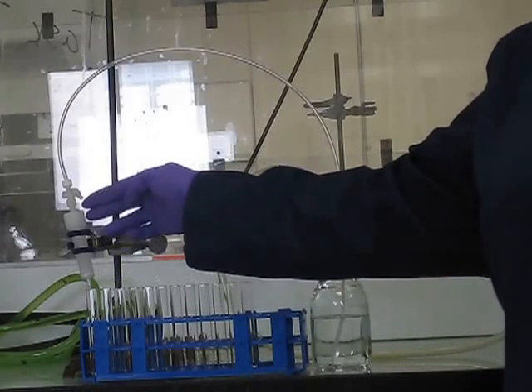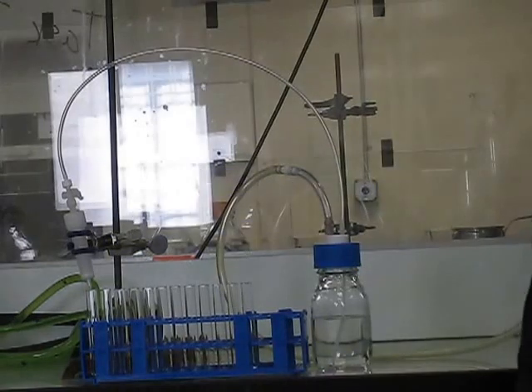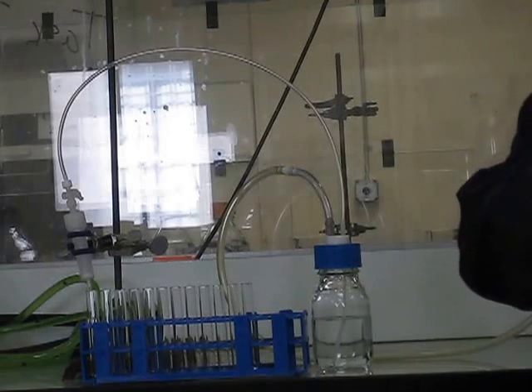When the silica cartridge is pre-wet, you may notice a slight color change. At this time, you would load your sample using a syringe.